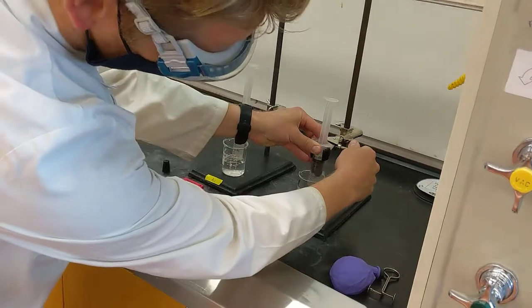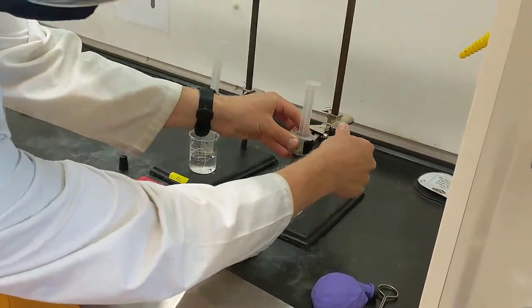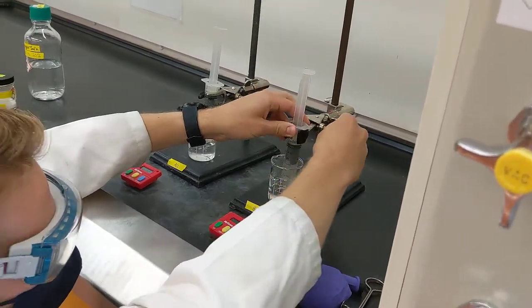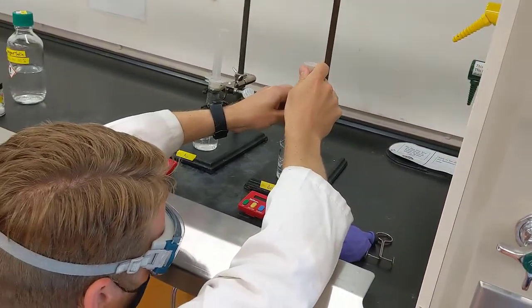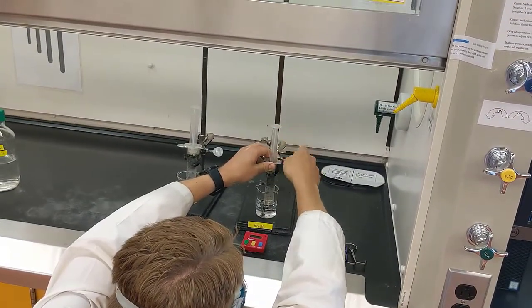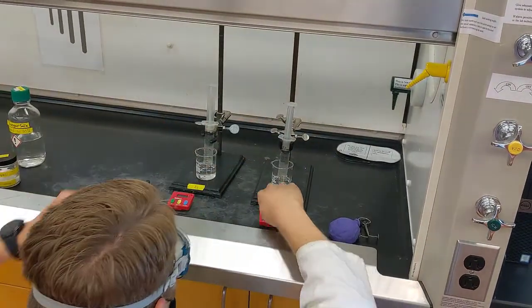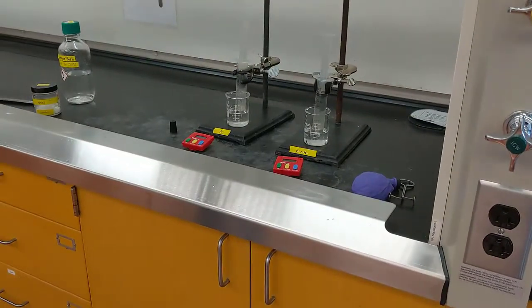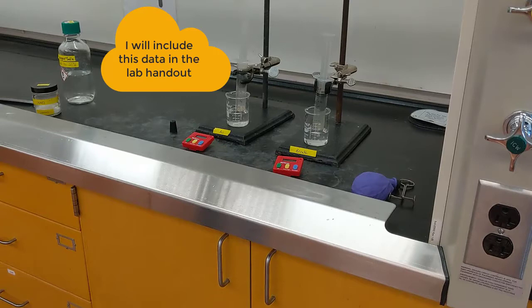Just like before, I took off the black tip. I'll put it clamped in my hood, and I'll ensure that the tip is submerged, and I want to pull up just enough water so that it starts at exactly 0.0 milliliters. And then I'll hit start. In addition, remember to measure the exact volume for the top of your plunger.